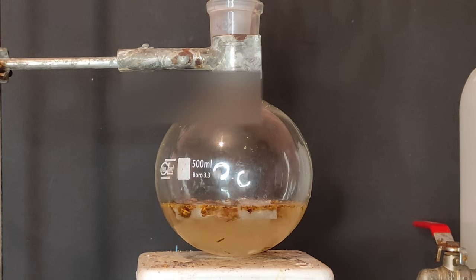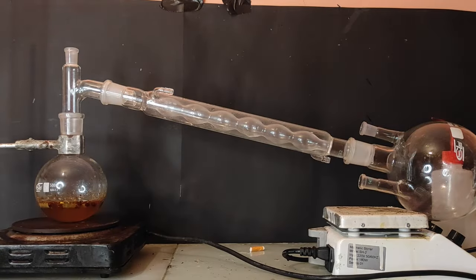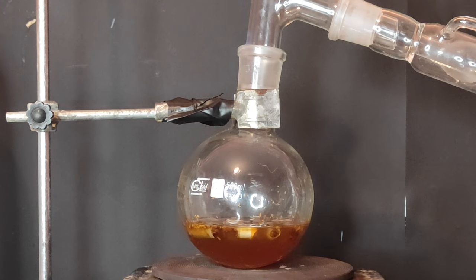After I've added the sodium hydroxide solution, I've set up a distillation apparatus. When everything was ready, I've cranked up the heat.